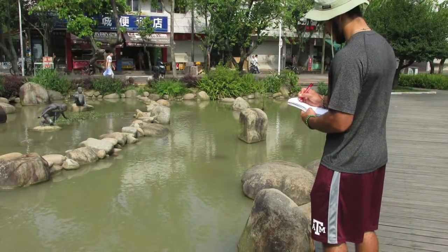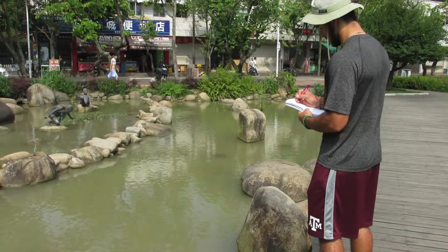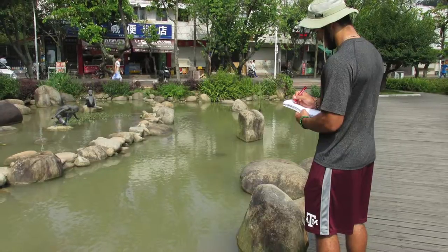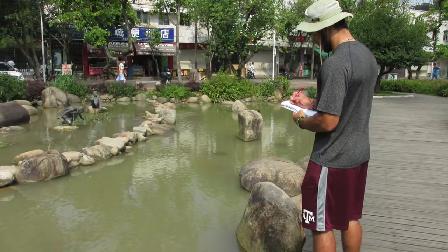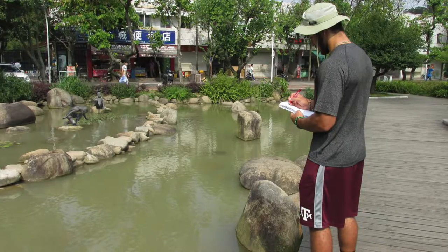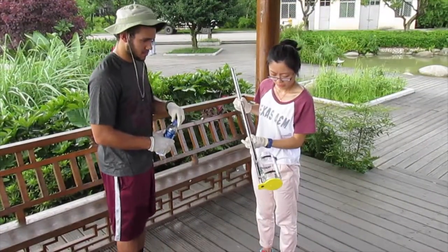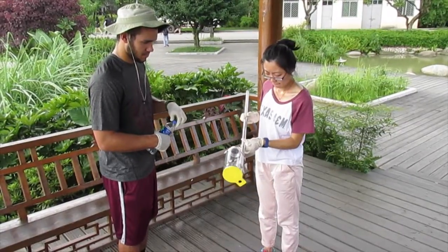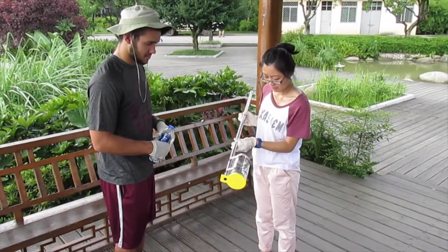Before beginning sampling, observe the site surroundings for any possible points of contamination or hazardous obstacles. Loose debris and soil nearby the pond are easily transported to the water body during heavy rainfall.